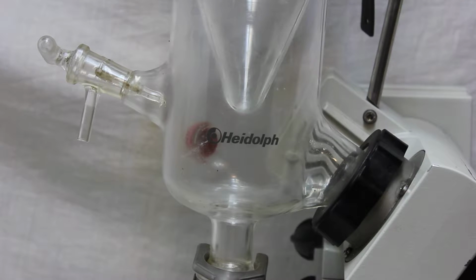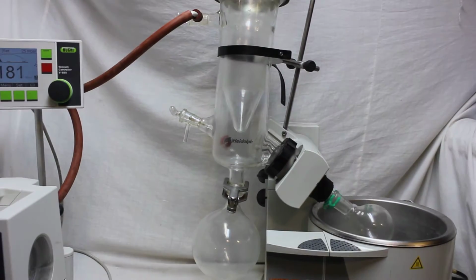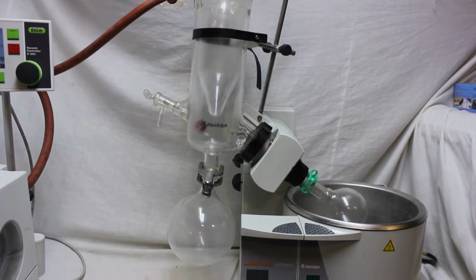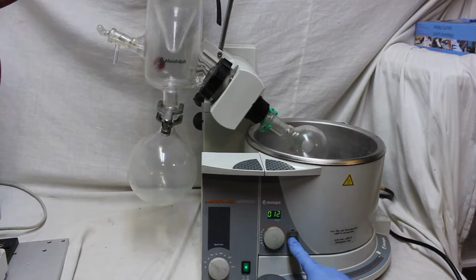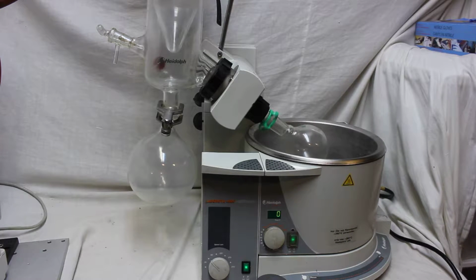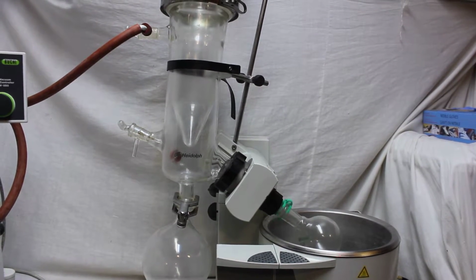And in this video I'm gonna show the Heidolph 4000 under performance on vacuum. And as you can see, the bath is just off. We can turn it on. I'm not gonna turn on the heat. And so as you can see, it's working nice and smooth.